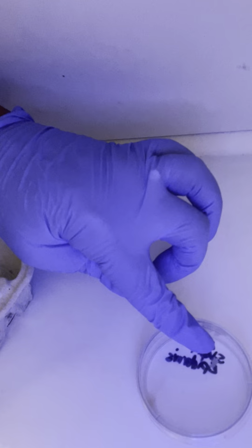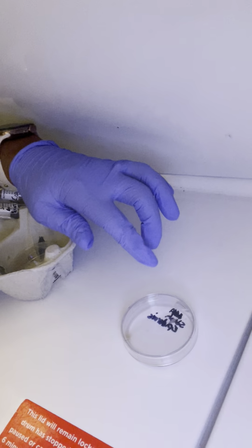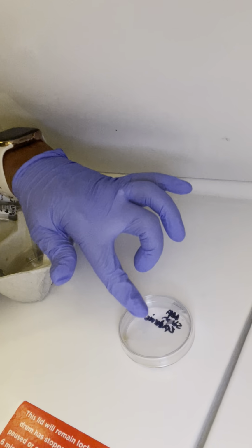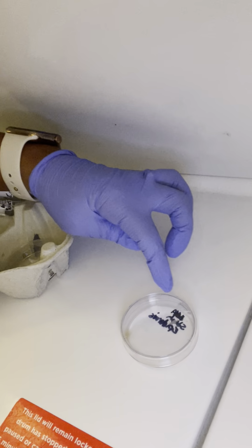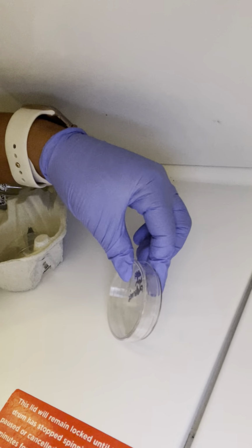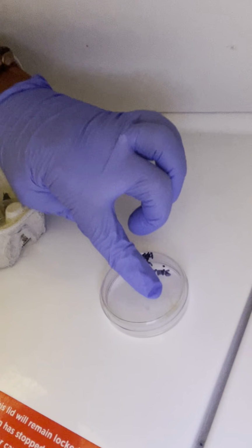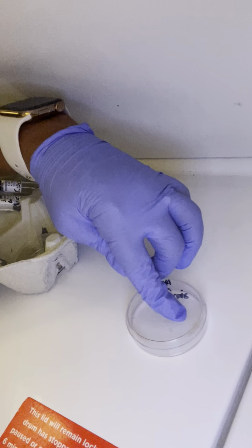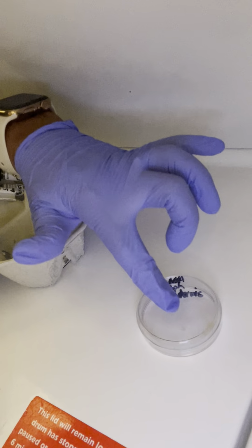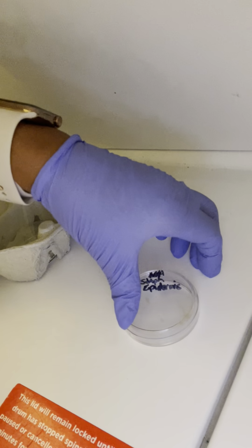It's in the middle and down a little bit, and then a little bit at the top around the sides. I'll turn it over, maybe you can see it better there. Here, a nice size form of culture has grown. That is the staph epidermis after 48 hours of incubation.